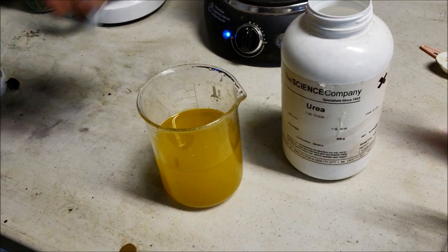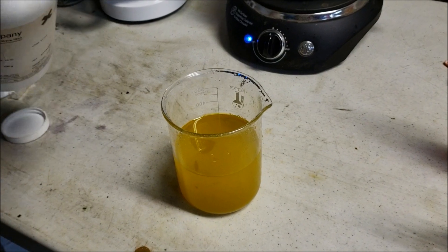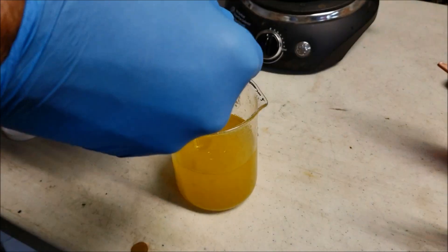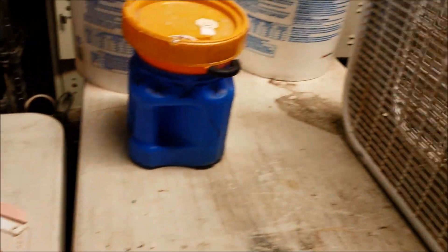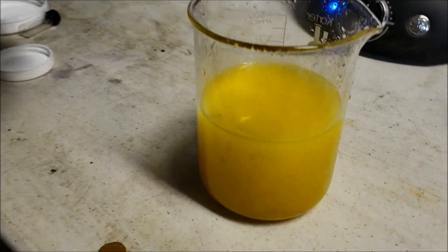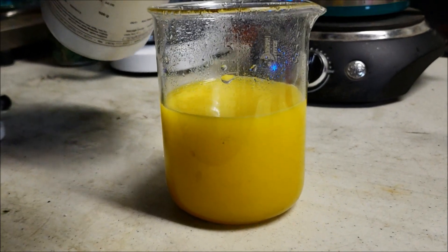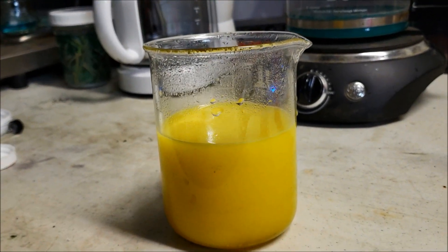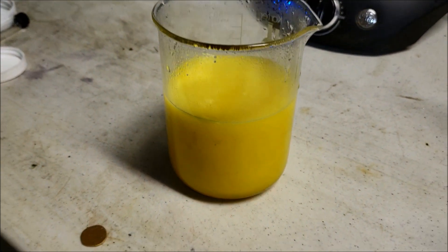Now we're gonna put some urea in there so we can deNOx it - make it so it doesn't burn anymore. Well ventilated, please, hence our fan. Put two of these in there. It'll stop reacting when it's deNOxed all the way.